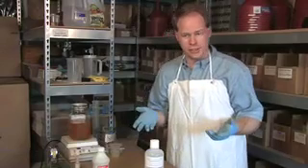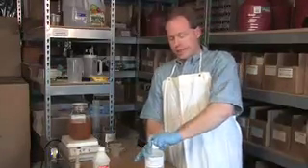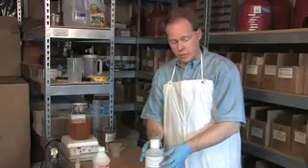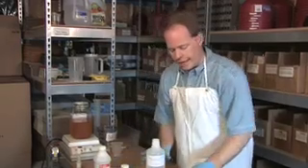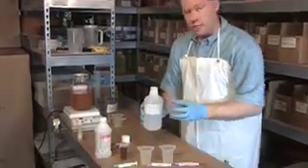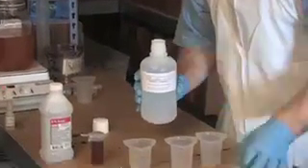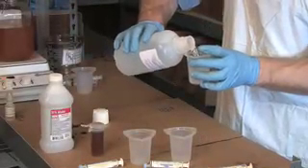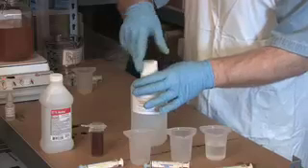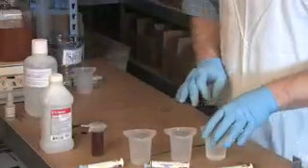Once you have your titration solution ready, it's now time to start doing the titration. Remember on the board we explained how to do it. We're basically going to take a known amount of base solution — this is our 0.1% base solution. I'm going to pour some out into a little cup. It's important that you never draw with a syringe from this because you can contaminate it. Always put a little bit in a cup, seal it right back up, and that way you have a vessel for doing it.